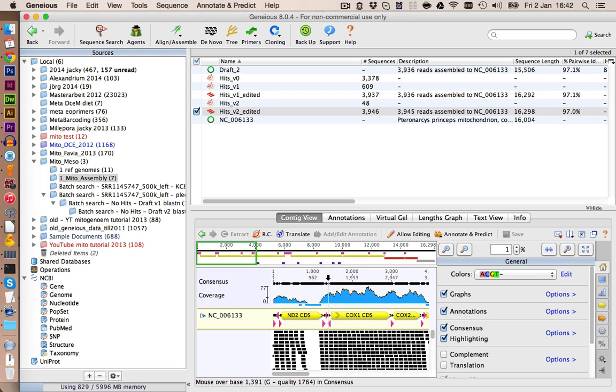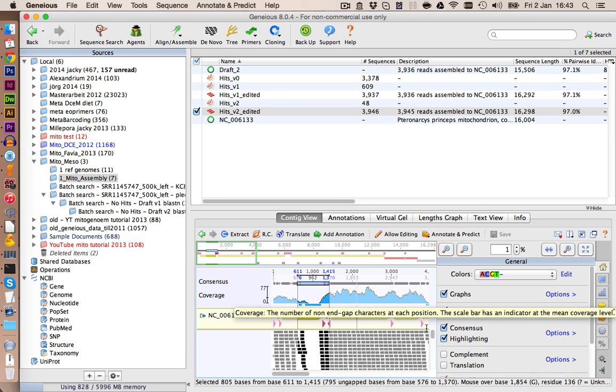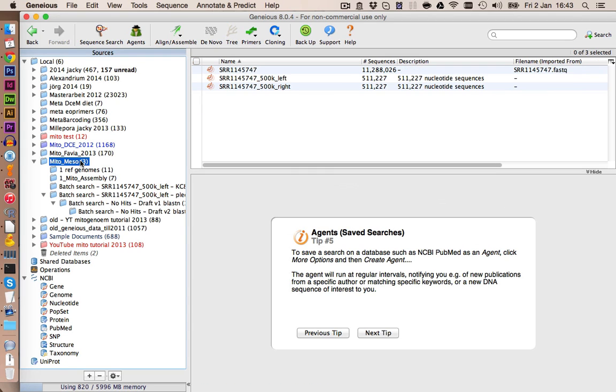And then we're going to use the hits we have from the left side, and the hopefully new right hits, and add all of those together and assemble those again against our initial Geneious reference genome. This way we can check if those gaps are due to low coverage, because then they would be filled, or due to problems with the dissimilarities of the sequences. So let's do this now.